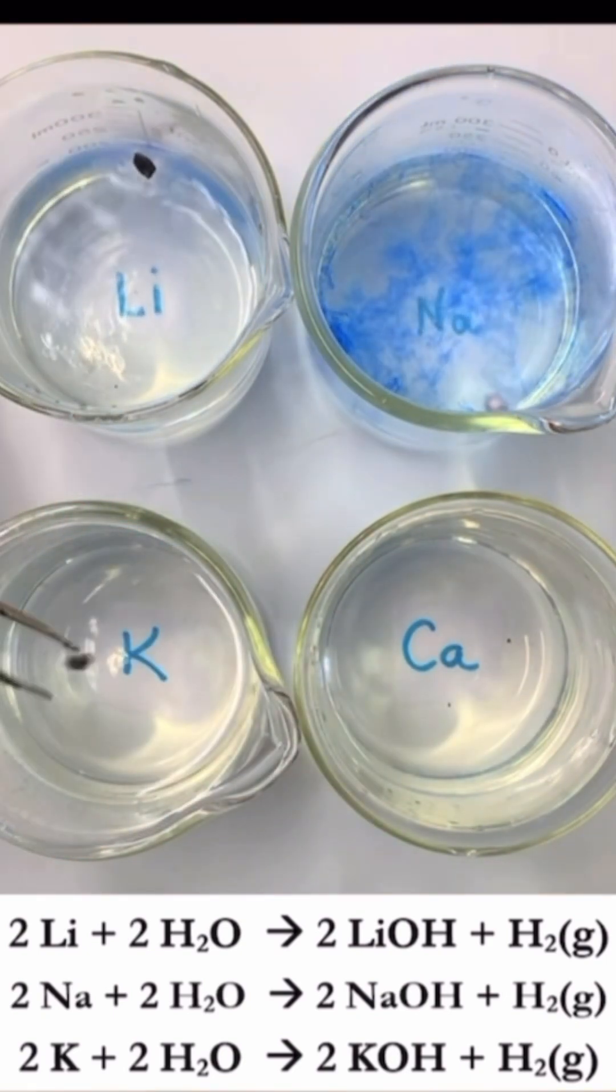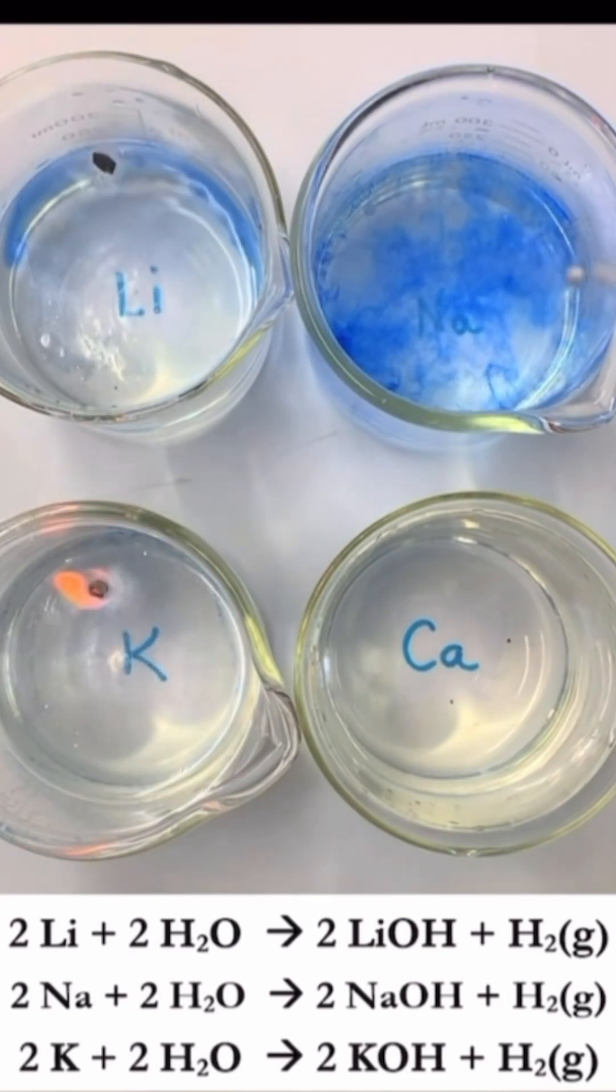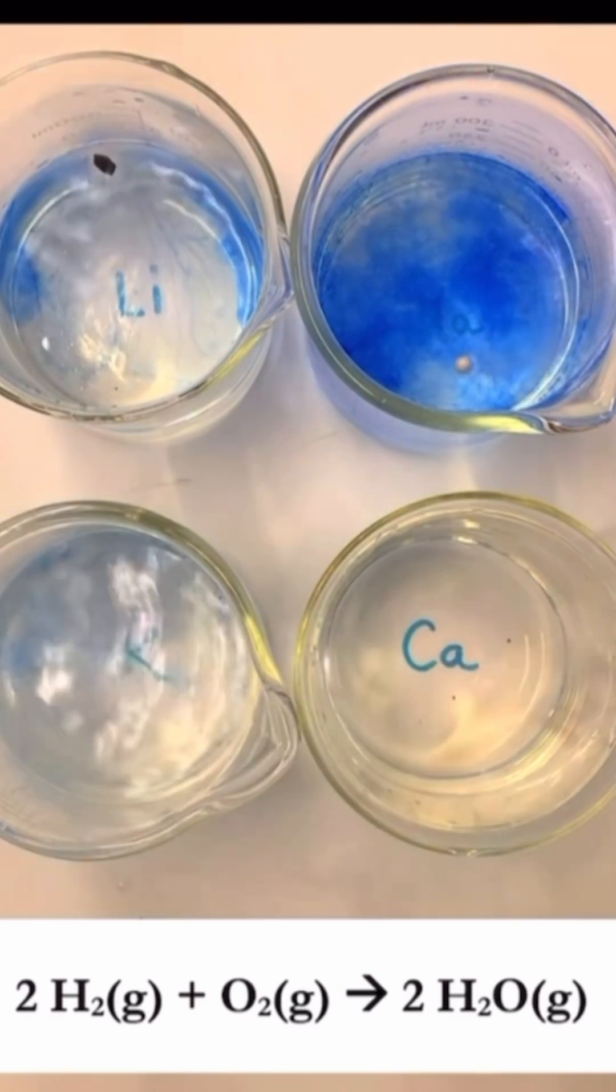Next, sodium. It reacts faster, skimming on the water's surface while also turning the indicator blue. The product? Sodium hydroxide.